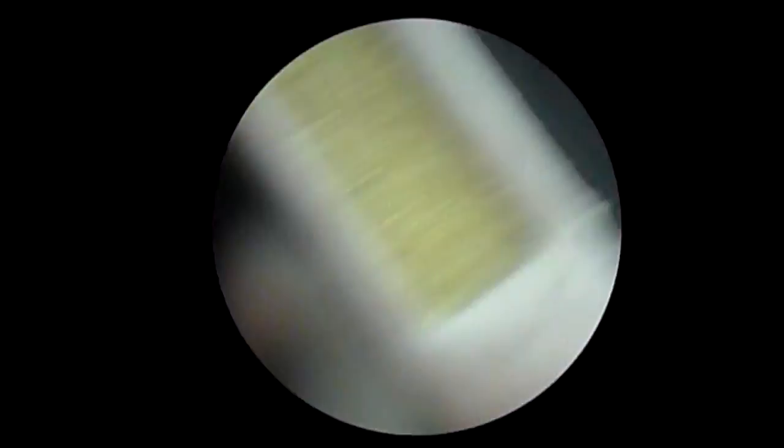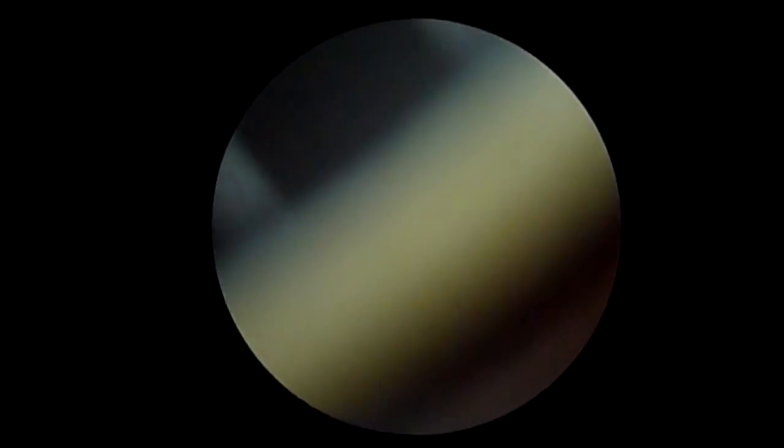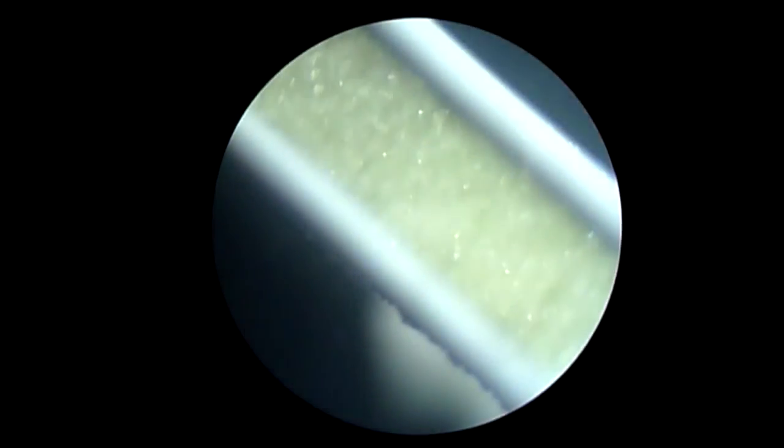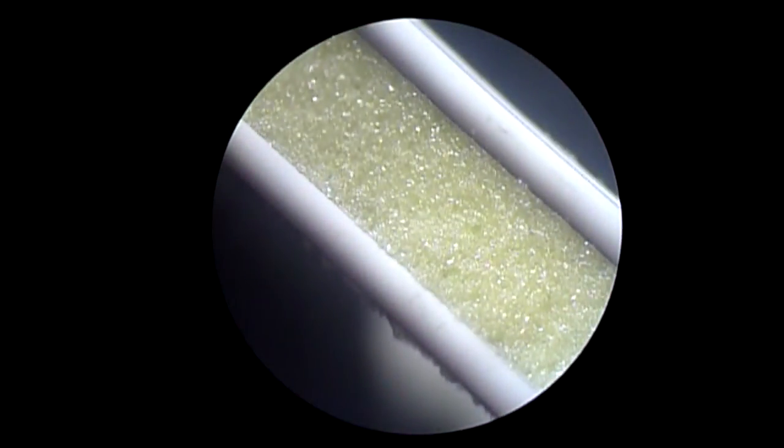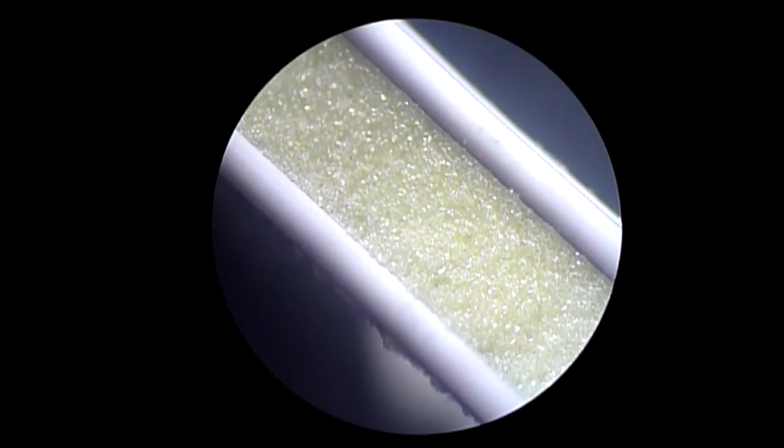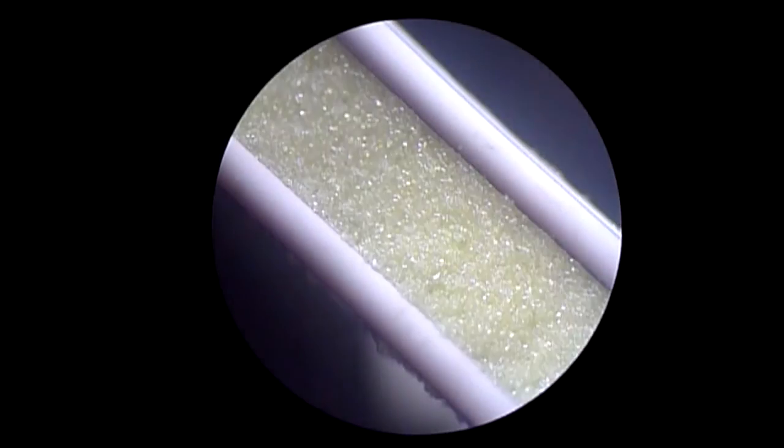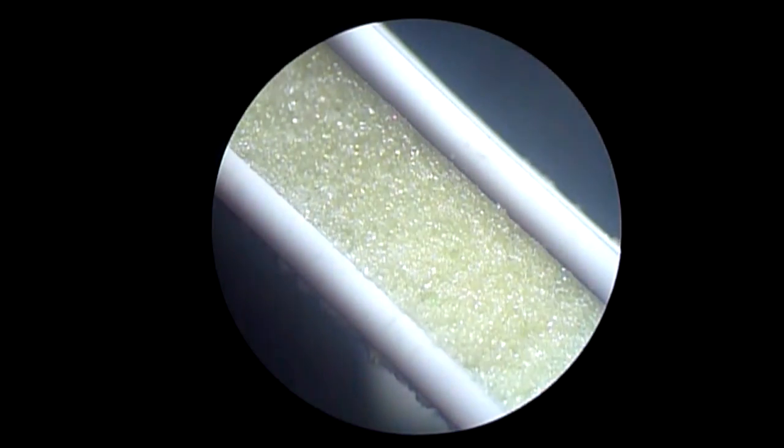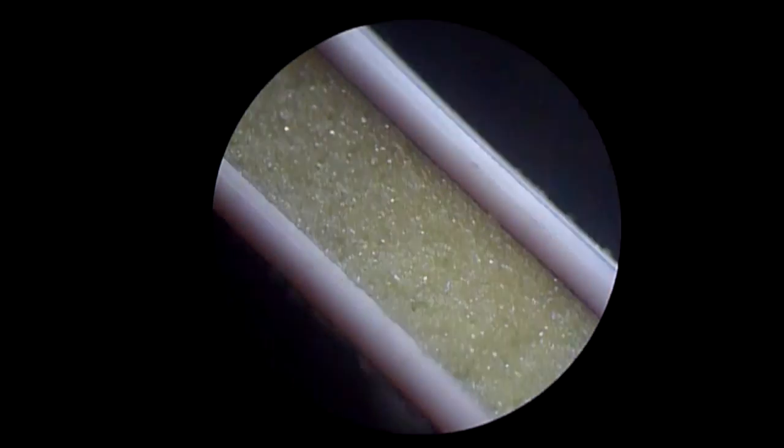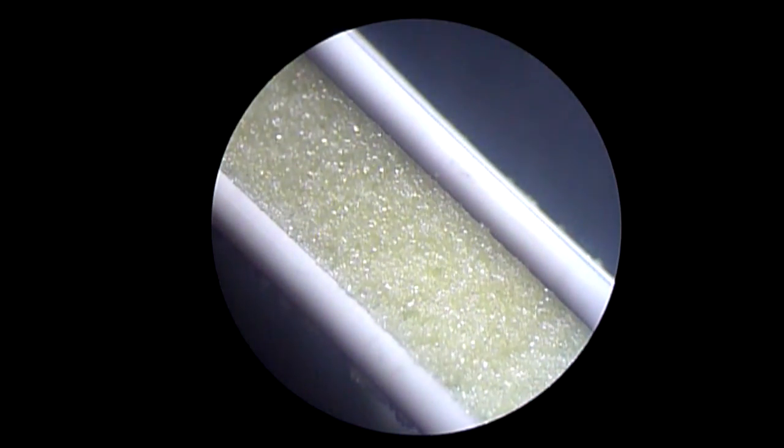I'll bring it up to a hundred now, and you can see it's literally flying along. I don't know what the experts think in this microscopy world, but I wouldn't mind betting this hundred's pretty well the sweet spot on this scope. It's so hard to work backwards on this thing. Look how crisp that is at a hundred times. It's even a pretty wide focus range. You can just light it however you want, get the right reflection. These little LED lights, I reckon they're just a revolution for this hobby.